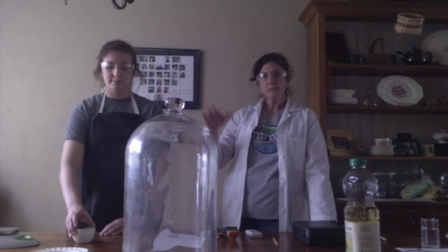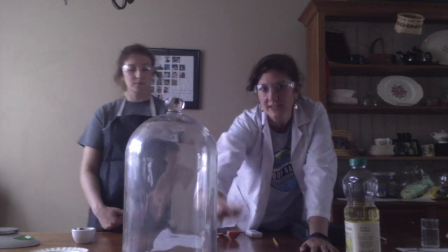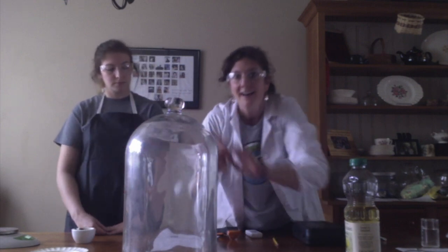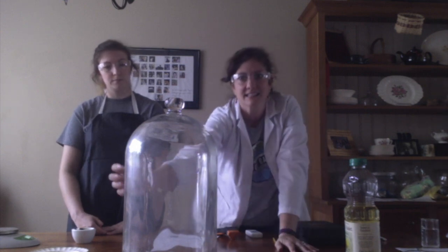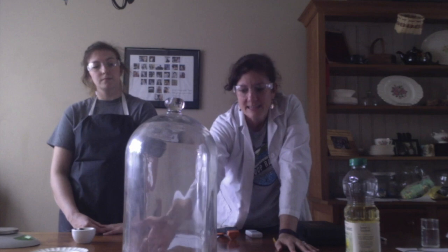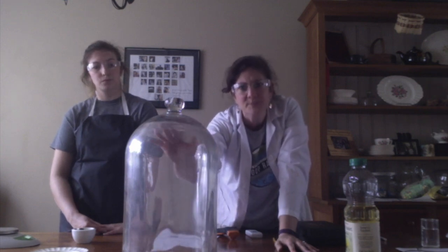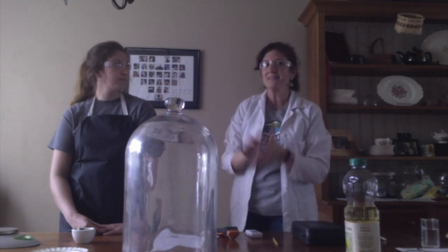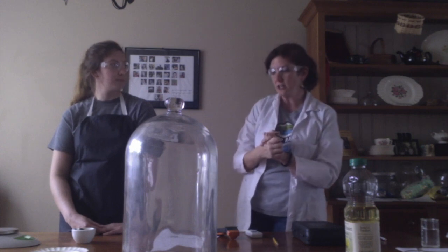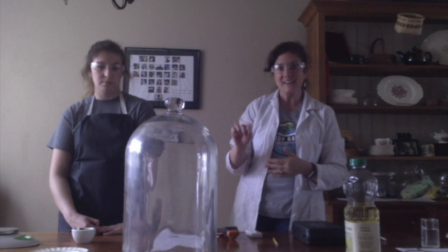Now, we're going to use this device up here today. This is called a bell jar, and you can see it's sort of like the shape of a bell. What's really neat about a bell jar is it's really thick glass, and it's able to keep almost everything inside. It makes almost a perfect seal there. It's really going to help us to collect our data so that things don't go up into the air and out into the universe, and we mostly keep it inside of our bell jar. So before we begin, we need some data about what's happening inside the bell jar.